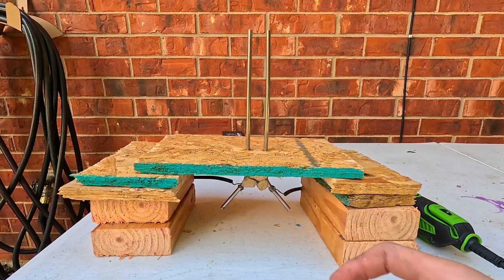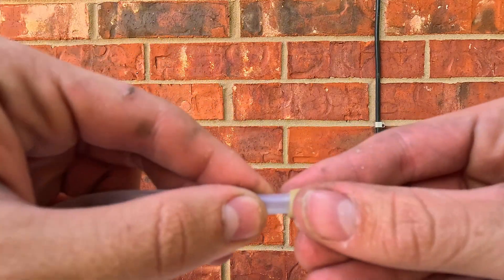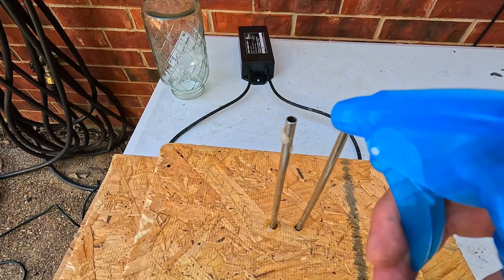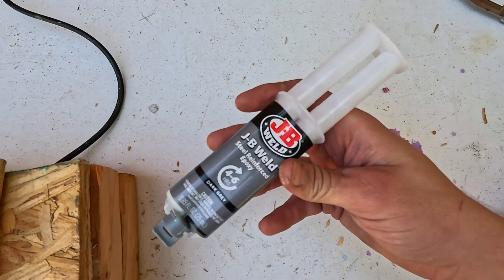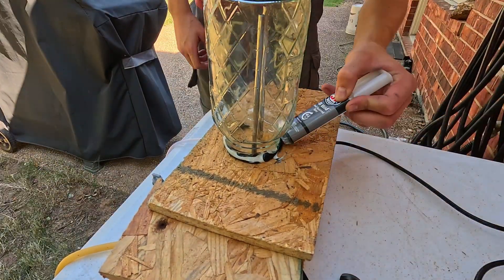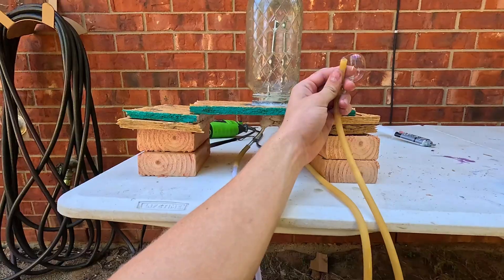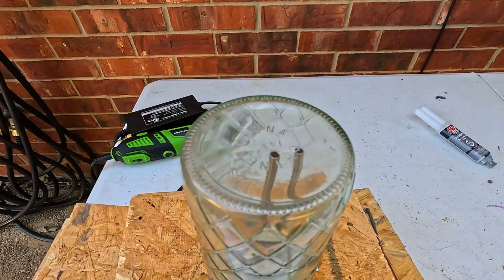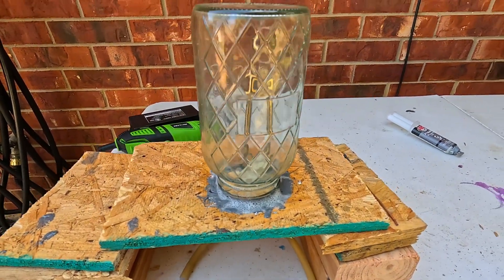Now it's time to turn it on and put our tubing in. Our fish pump pipe doesn't fit on our straw, so instead connect it to your latex tubing, then take your latex tubing and put that on the straw. To pressure test, use a bottle of soapy water — I just tested all of our seals and we have no leaks, so we're good to go. Now we just need to put our mason jar on and seal it with JB Weld, or you can use anything like super glue. So we have the system properly running with no leaks — let's see how much nitric acid we can produce.